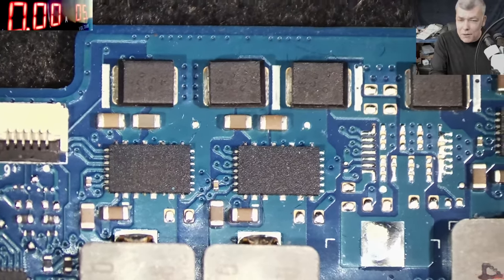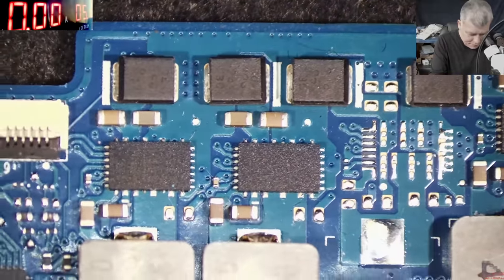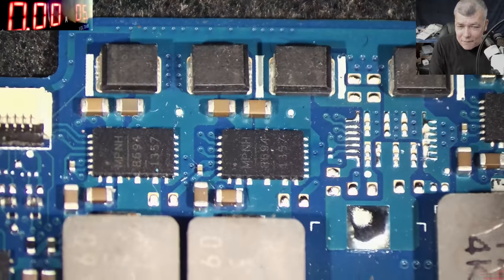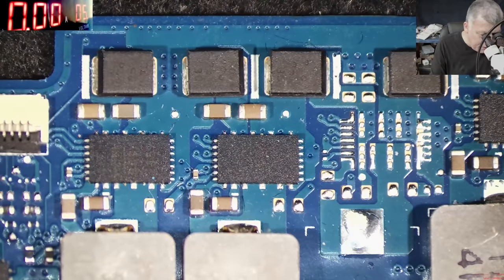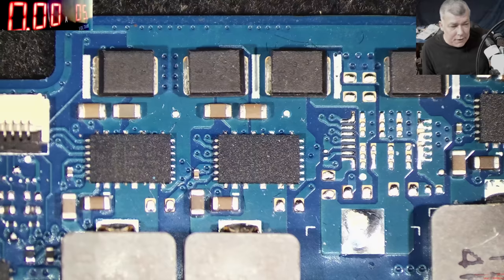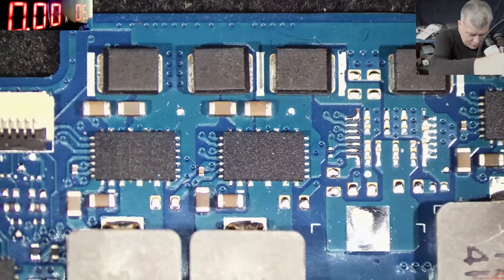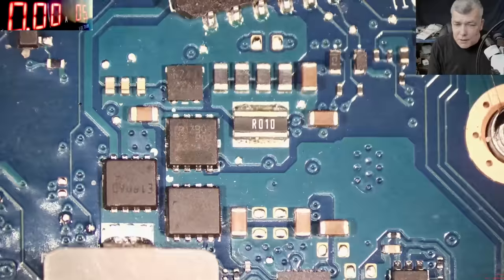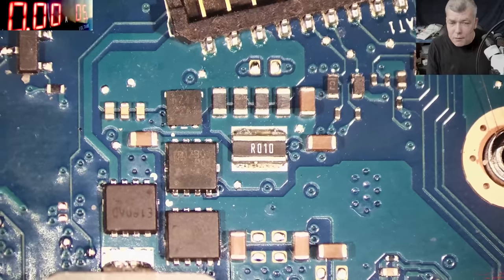Now it's kind of a different story — we have one and we have the other. So now we have both lights and it's kind of different. I can clearly see there is more light. We can go further — yes, I can raise the current; probably right now it's not enough current. I can raise the current and get as much light as I want. You won't see much difference in picture quality, but I can see on the camera noise — it's less noise. That means there's more light.